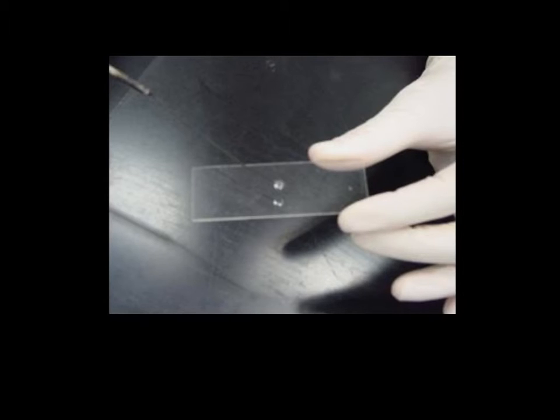We have to be patient and allow the bacteria to dry so that we minimize contamination and also minimize any kind of infection to ourselves.